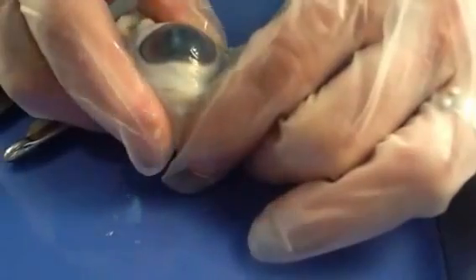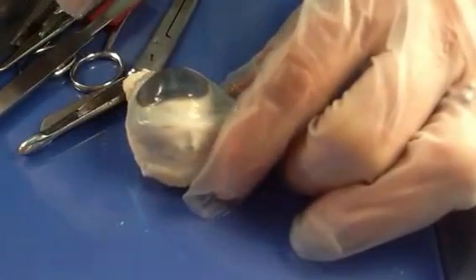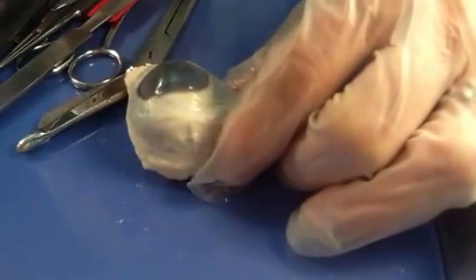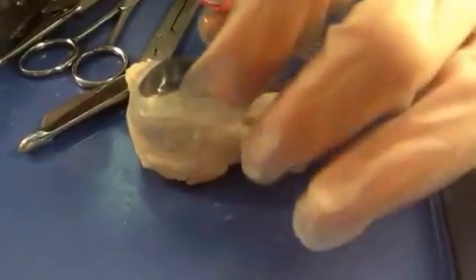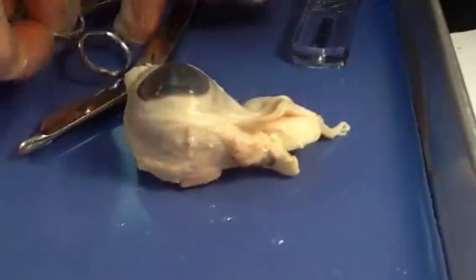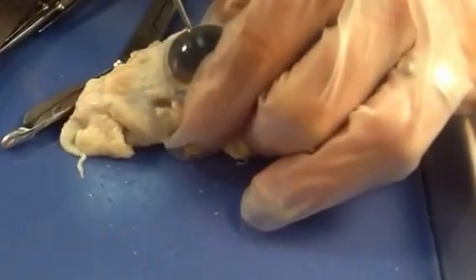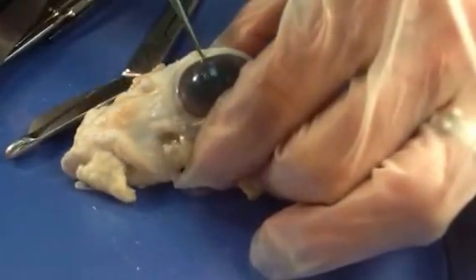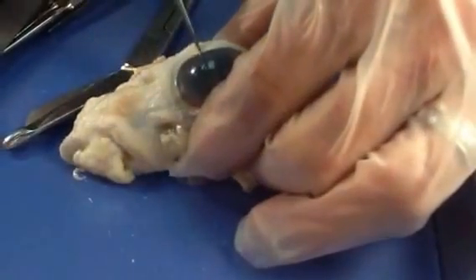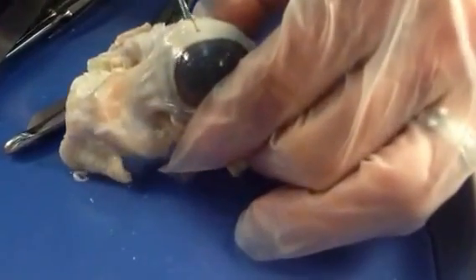Because this is really, really tough, I do not recommend using a scalpel. As we saw with the dura mater on the brain, it's very hard to cut through that outer layer. As you're pushing really hard and you finally get through, you're going to put so much pressure that you'll have a little fountain of inner juice. What I recommend is scissors with fine points — snip a little opening so you can get one point of the scissor through. Maybe poke a little hole. This is pretty tough stuff. Now I see a little juice, a little fluid coming out of there.